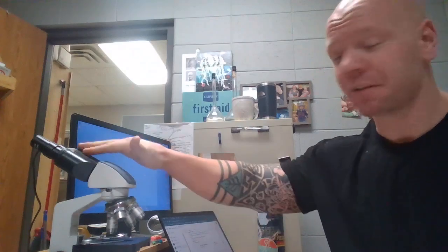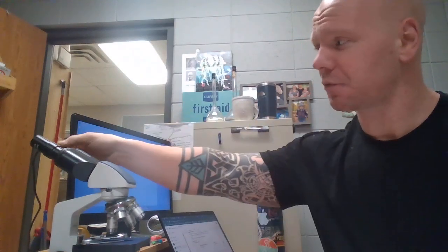So let's get started. If we take a look at a microscope I have set up here, I actually have a couple of additional features. That's going to be a camera piece so that it pops up with a big screen. But let's start with the head. This is the head of the microscope. It is where the objective lenses are connected to, and these are what allow you to see at your various different zooms. All right, and if you look up at the top here, we have our eyepieces. These are what you're going to be looking through. And inside of one of my eyepieces, I actually have this additional piece, which is going to be a camera. This allows me to put it up on the screen right here.